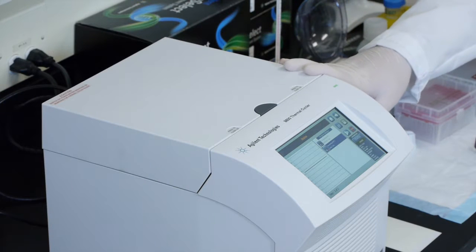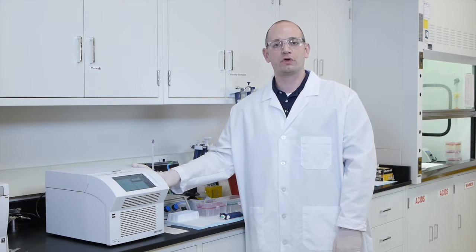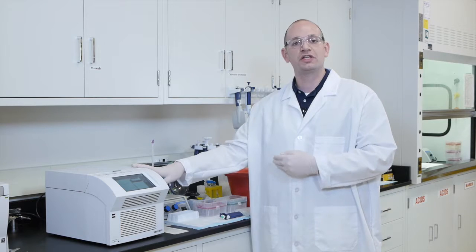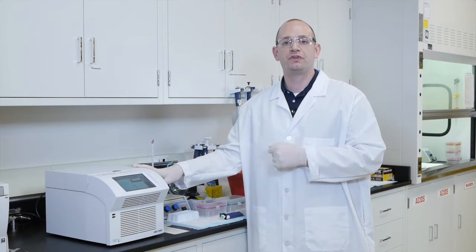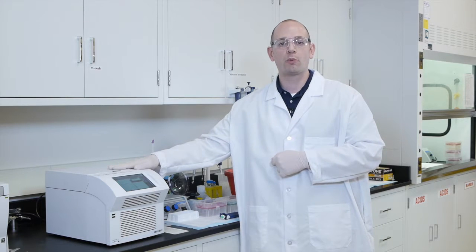After the 5 minutes has elapsed, we're then going to perform the third step of the hybridization protocol and add our capture library, which is essentially our SureSelect Baits mixed with a diluted RNase block onto our PCR machine to also warm up to the 65 degrees that the block is being held at.